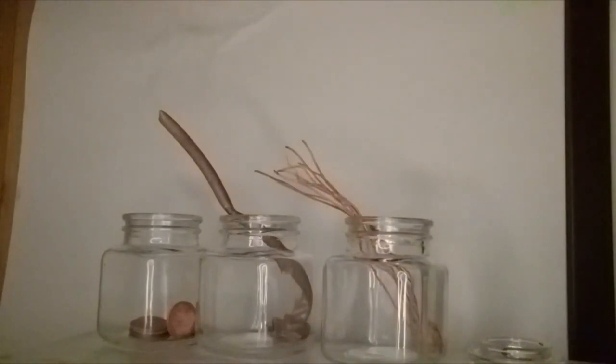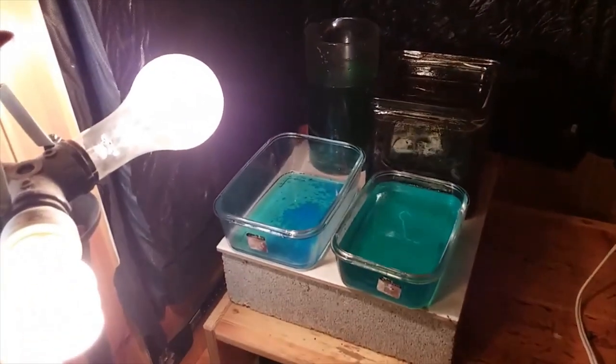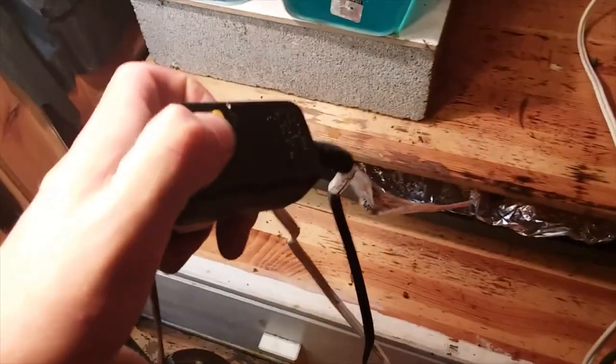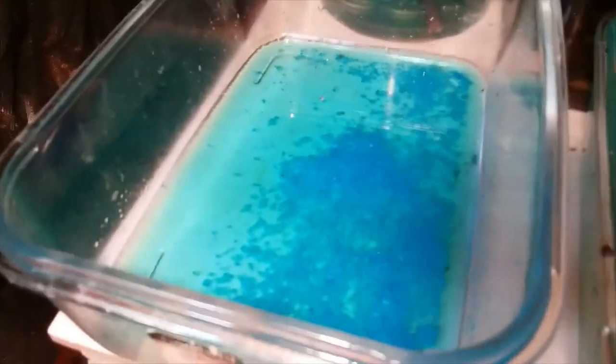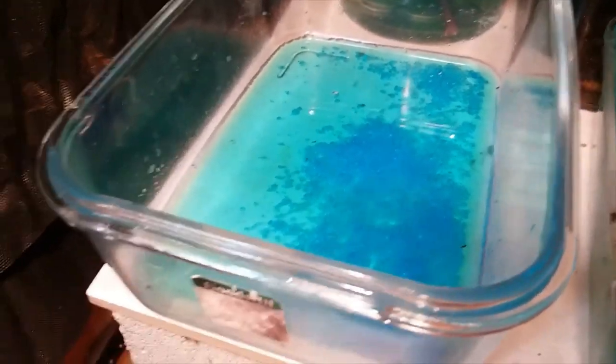That is out of this world, our copper sulfate is crystallizing.